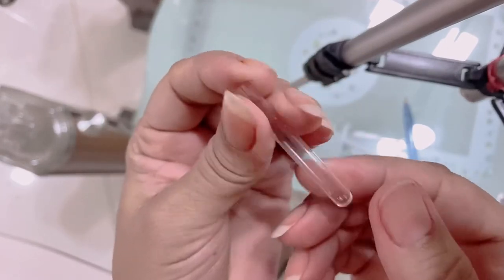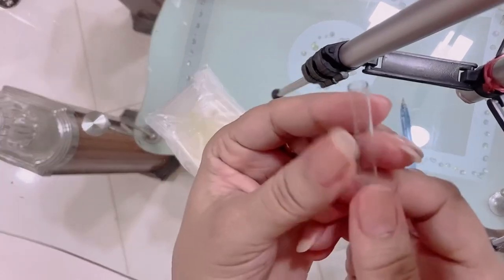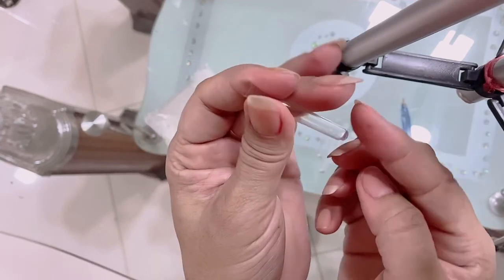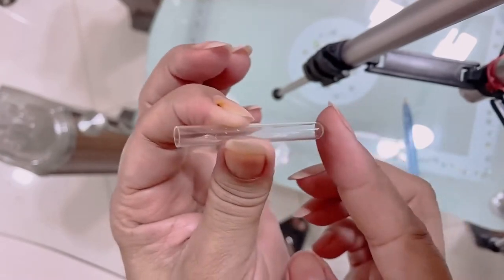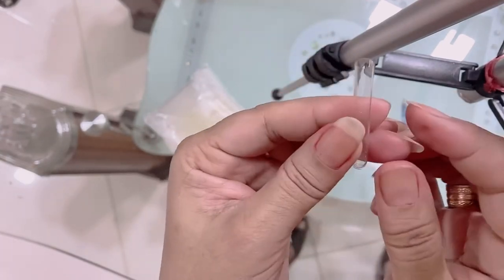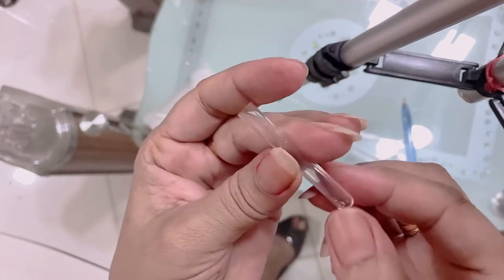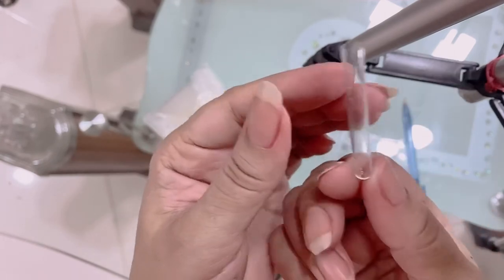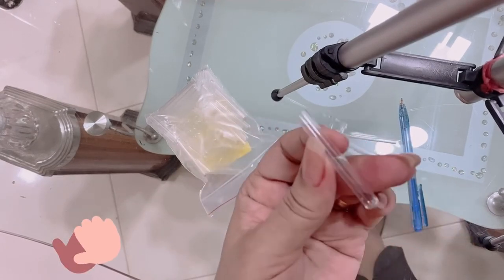Pyrex ignition tubes are the best choice for labs. They are plain and made of borosilicate glass, with a round bottom — as you can see on this one. Another form is transparent ignition tubes, which offer around 1 ml capacity. These tubes are used for fusing materials and are disposable, so there is no need to wash them. I hope you liked this video and now know what an ignition tube is. Thank you very much.